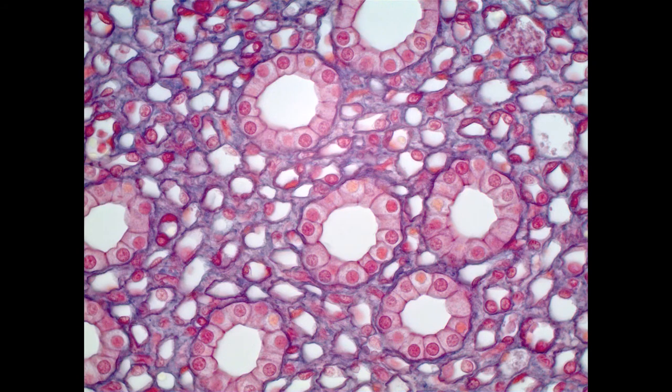If we move on to the next example, this is a section through kidneys. We're using the kidney as a really nice example of simple cuboidal. The second type of tissue that we'll be learning is the simple cuboidal. The name is similar to the first one. The simple part means it's a single layer, and the cuboidal is describing the cell type. So this is a single layer of cube-shaped cells.